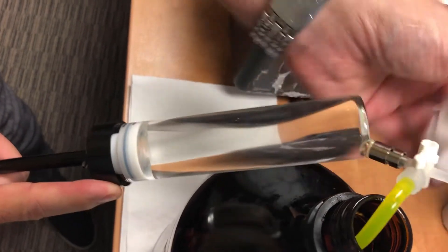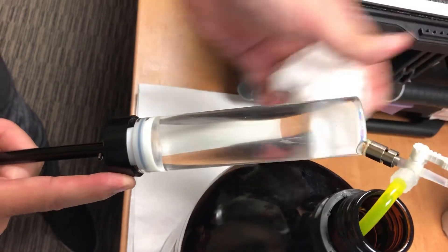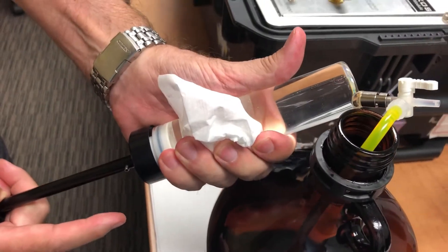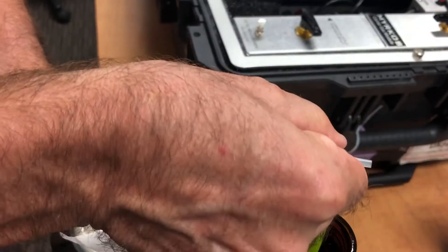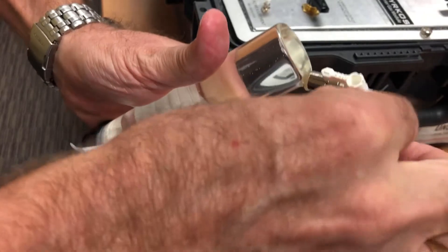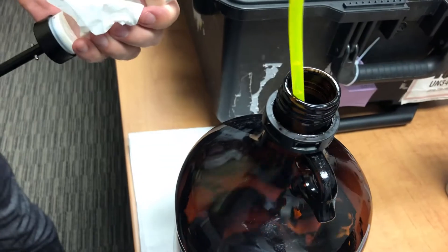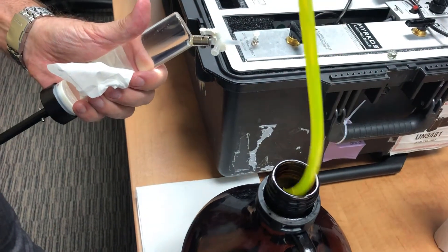Now we push up the air and we're going to finish filling up the syringe. So when the syringe is full, you close your valve, you disconnect like that.